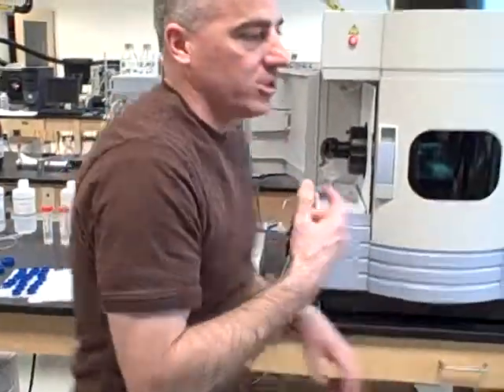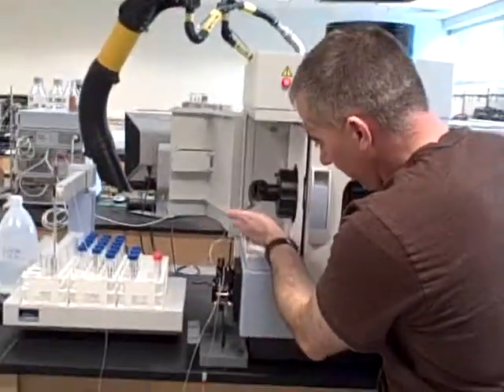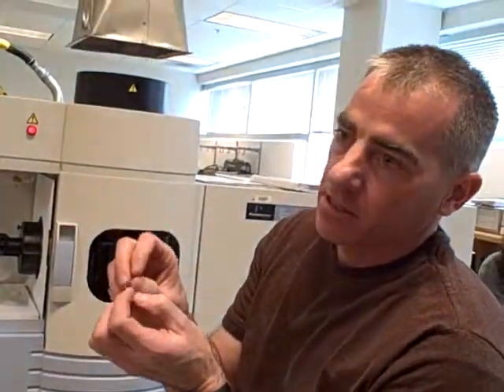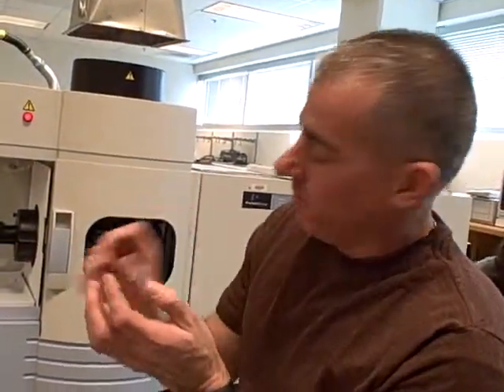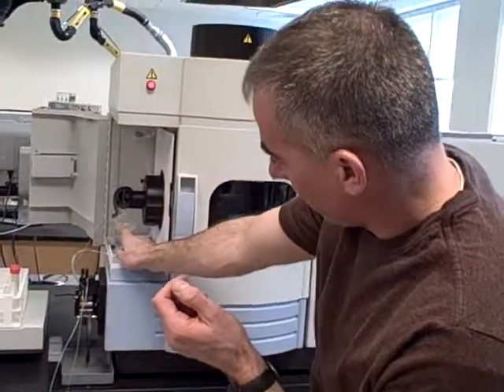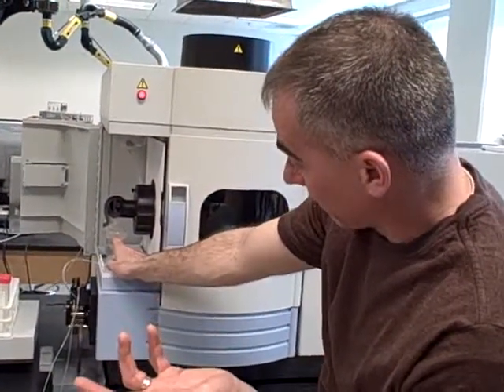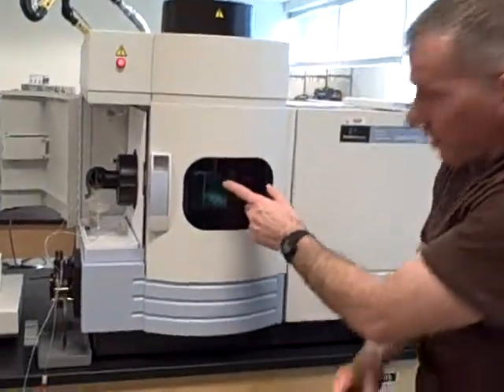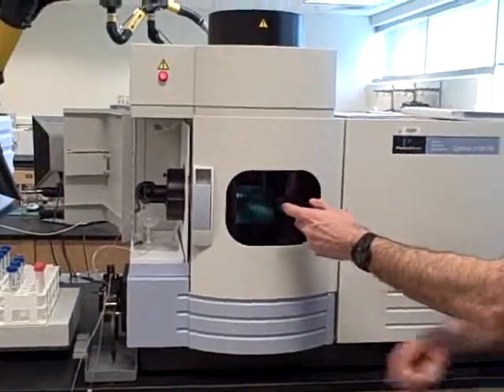It helps if you shine a light on it, but essentially, as the sample comes in, it goes over a high velocity gas and it nebulizes, meaning your sample is made into basically a mist, or a fog, of sample. A little bit of that is carried up into the instrument and carried into a plasma. If you look in this window, you can see what looks kind of like a candle.